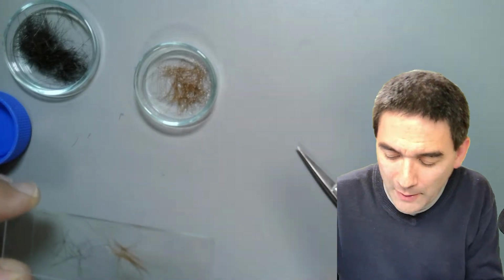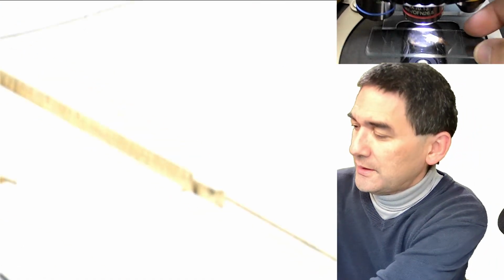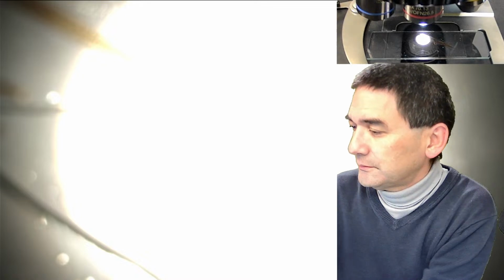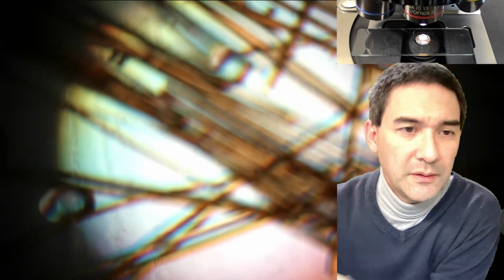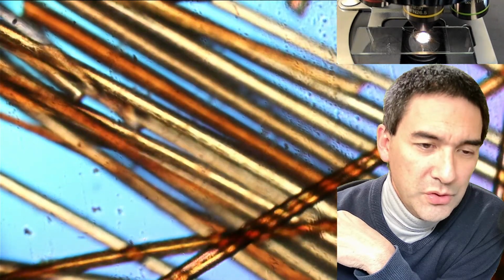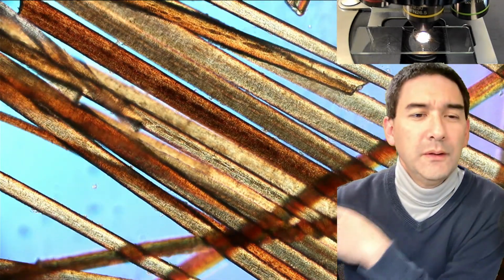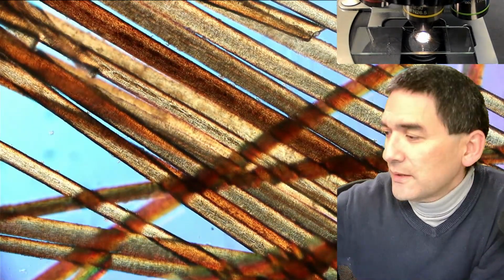Let's have a look at this under the microscope, how hydrogen bleached hair and regular hair look. Here we go again. Let's see. Put this away here, it's too bright. So this one is now the hydrogen bleached hair. I should probably adjust the microscope a little bit better, I'm losing parfocality all the time. Yeah, and I think it looks kind of nice, because you can see more details.